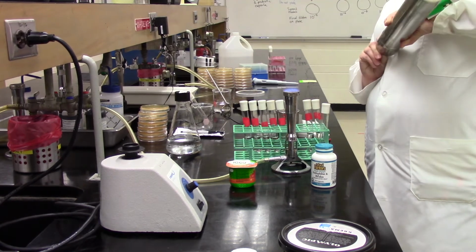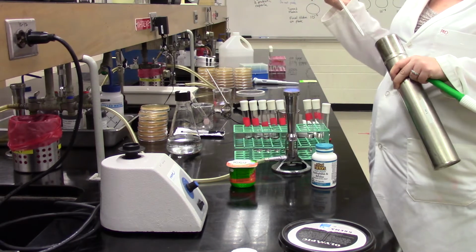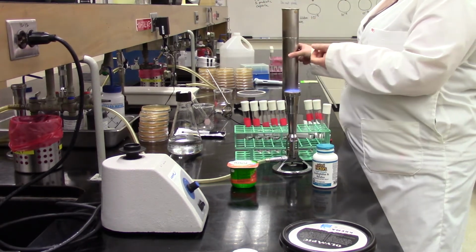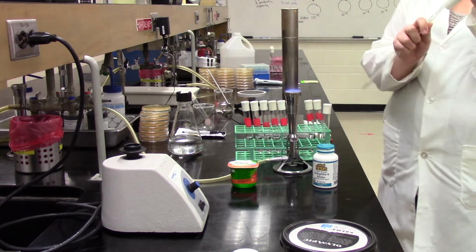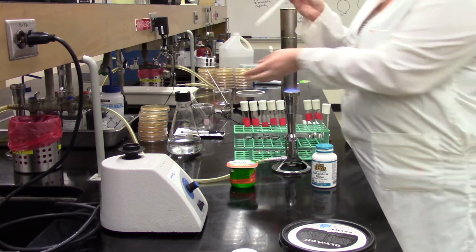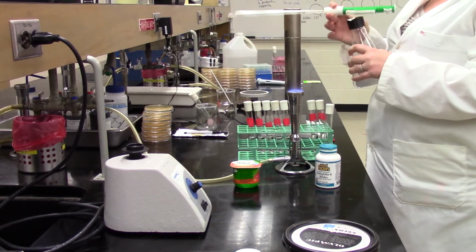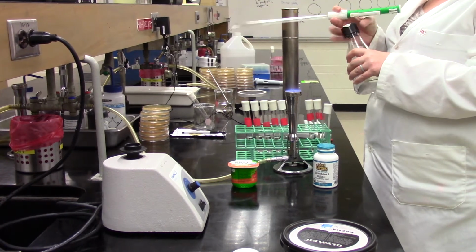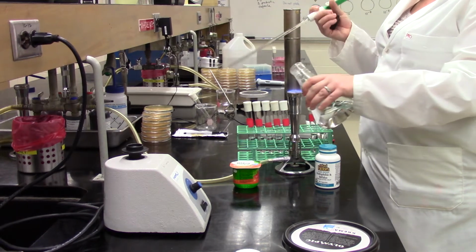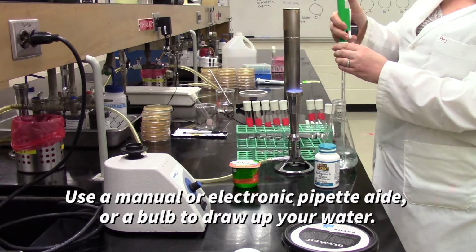Right now, she is preparing 5 mLs of distilled water, and we're going to dilute out the contents of that capsule in that distilled water. So she's got a glass pipette and a pipette aid that's going to help her pipette up that 5 mLs of distilled water. She's going to flame the neck of that flask of sterile water that we have prepared, and then she's going to use that pipette to draw up exactly 5 mLs.